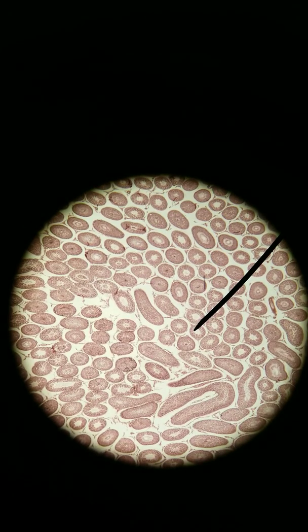Hey everyone. We are looking at the histology. Right now we're looking at the histology of the testes, and we'll look at the ovaries next. But we're going to look at these reproductive organs, specifically in the lens of, no pun intended, the endocrine system. So what hormones they produce and which cells are producing them.